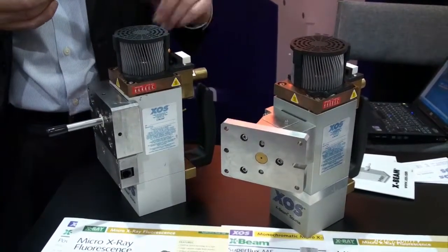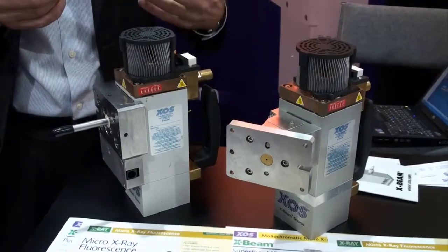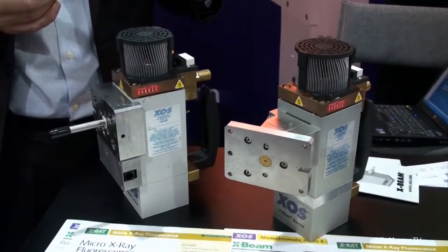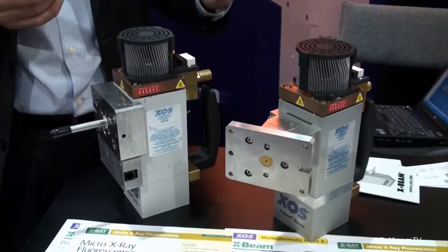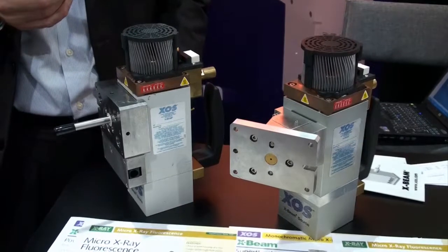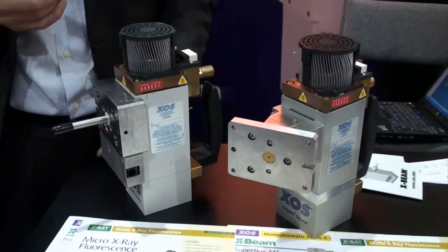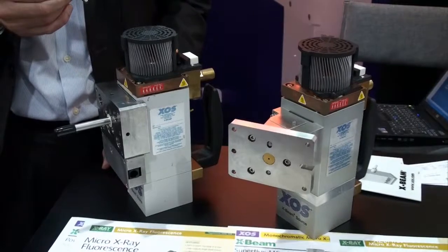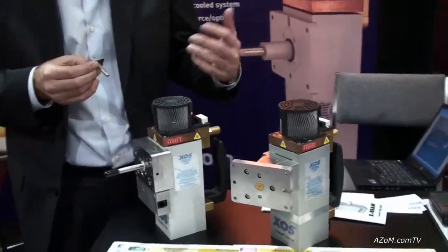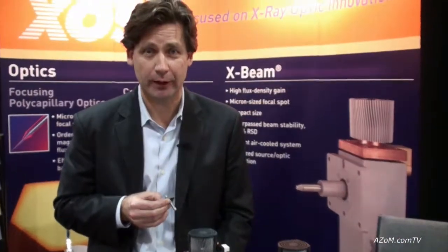These are the products we offer for integration into other X-Ray instruments. We also make our own analytical instruments, and those instruments are more application-specific — particularly for the petroleum industry or for consumer applications — but we do not display them at this particular venue.